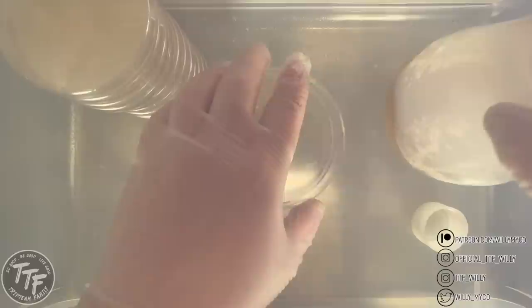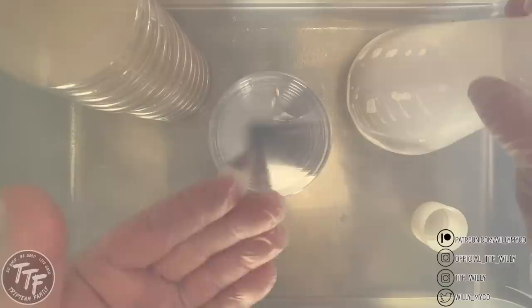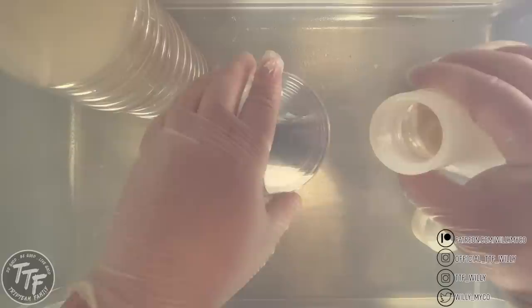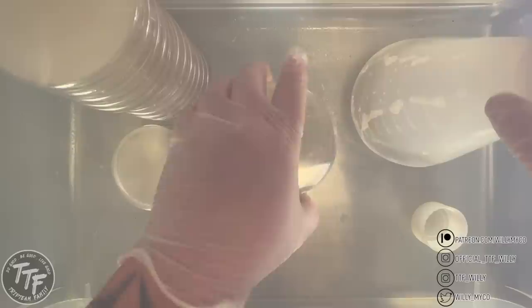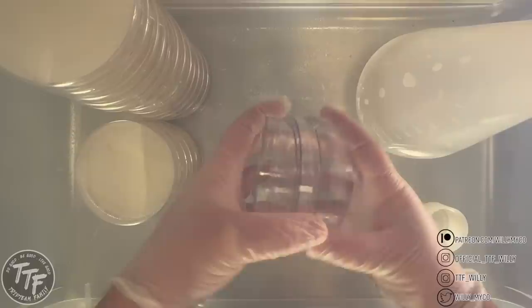There's a trick to pouring agar — you don't want to pour too heavy and you don't want to pour too light. If you pour too heavy, you're not going to have enough room for mycelium to grow because it will be too close to the lid and will grow onto it, giving you a higher chance of contamination. If you fill it too low, your agar can actually dry out before the mycelium fully colonizes it the way you want. So you want to fill it just right.